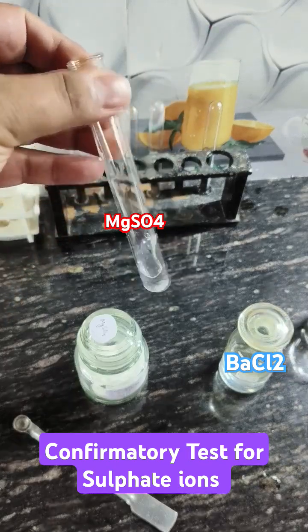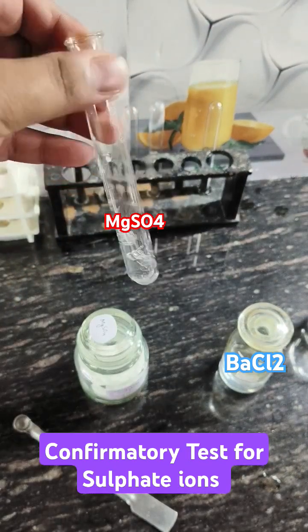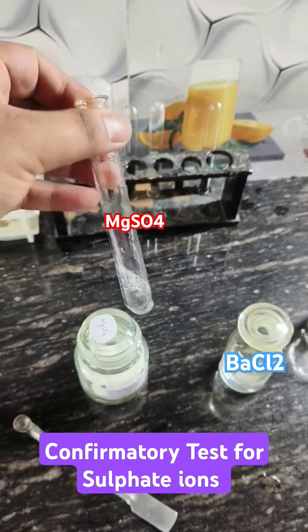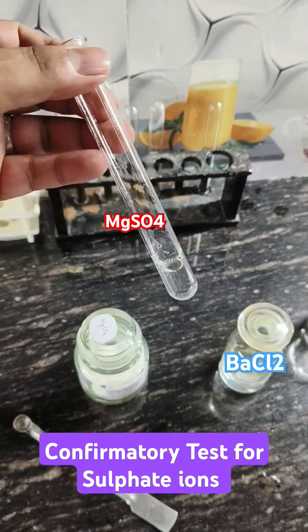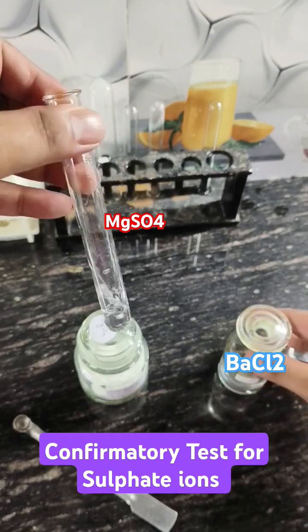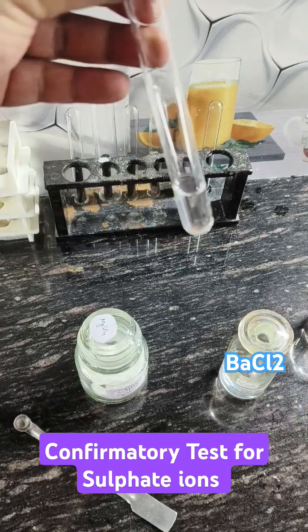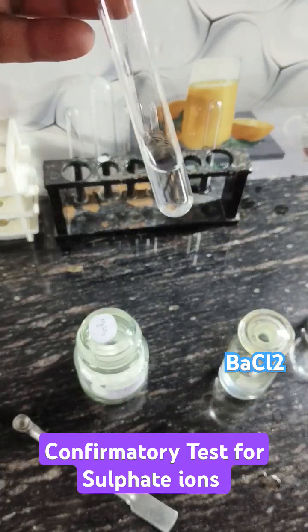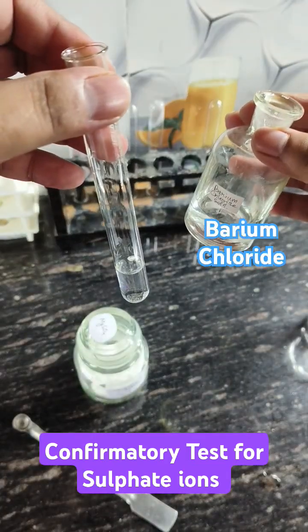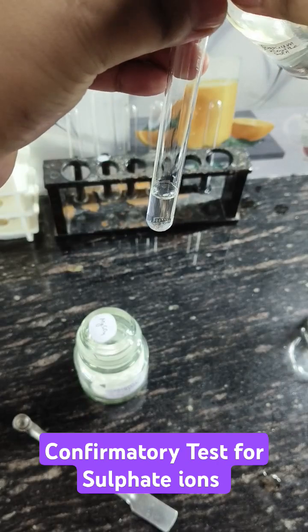Now to distinguish it with sulphite or sulphate, I will have to dissolve these white precipitates in concentrated hydrochloric acid. If the precipitates are dissolved, that indicates sulphite, SO₃²⁻.